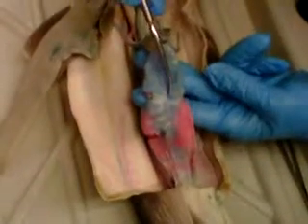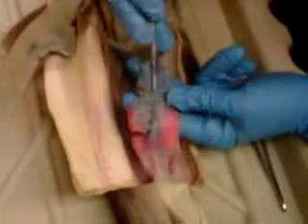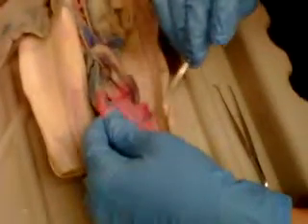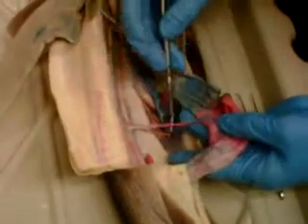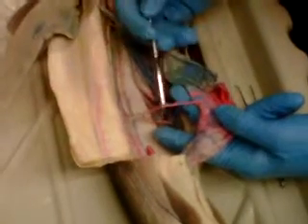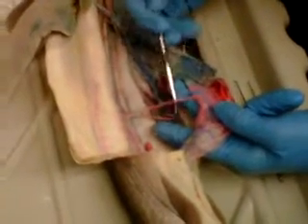Then it continues on here and turns into the anterior intestinal artery along the top. And then these lines coming off are annular arteries. You go down here, this is the posterior intestinal artery. It's going to branch off, so it's here, branching off and going to the dorsal aorta, and this is called the same thing. This is the posterior intestinal artery.